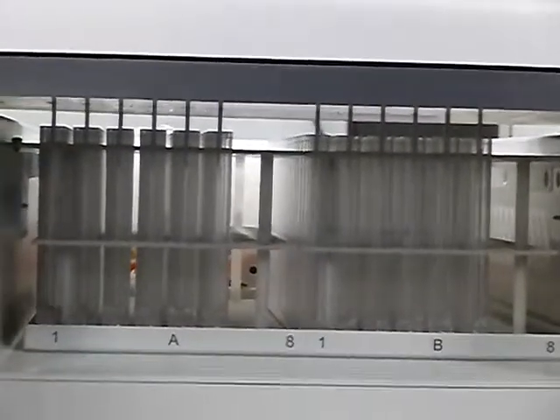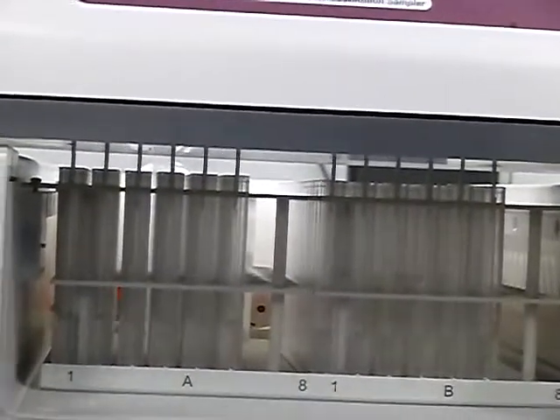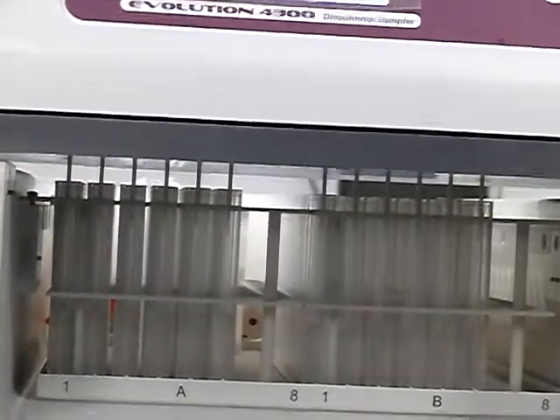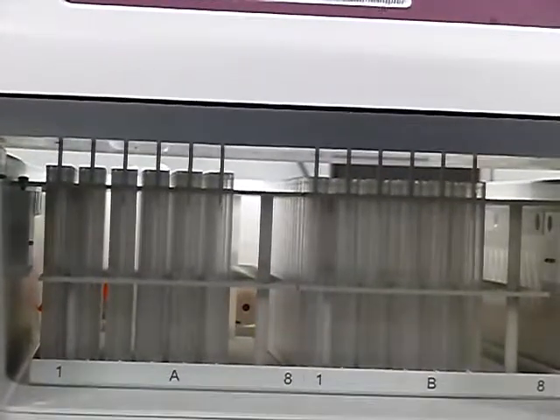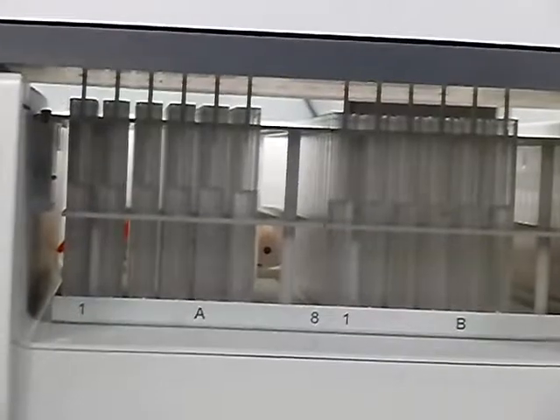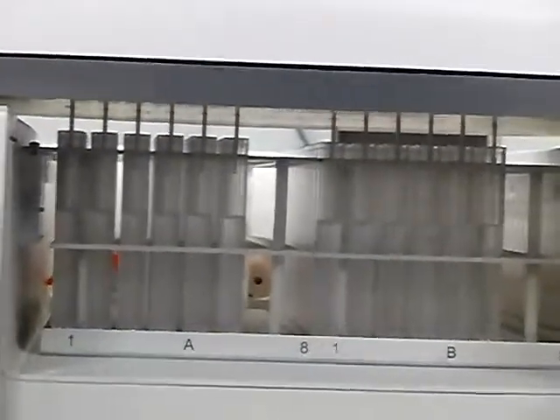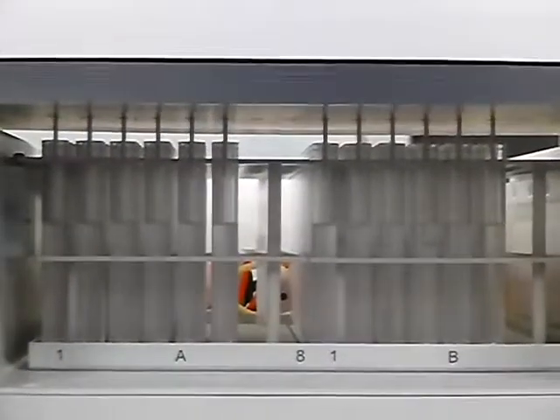See, they're so close when you validate speed. When you're at 12.5, you're at a very fast drip. At 25, it's a pour, a straight line pour. But at 25 is also where you're really going to find out if you've got a needle blockage. The same here at 12.5, it's dripping. You're going to find the one that's not dripping, that's spraying or shooting off. Then you know it's a needle clog.